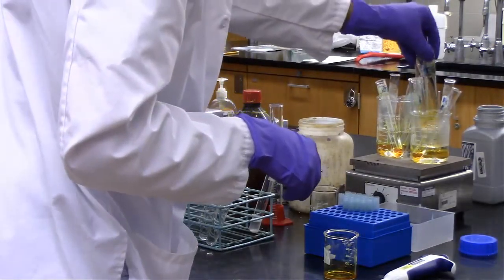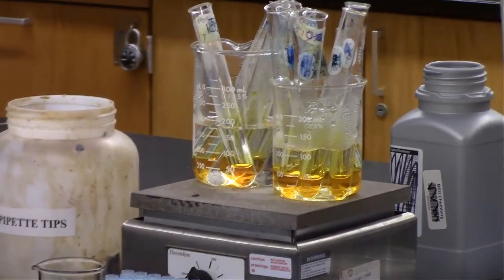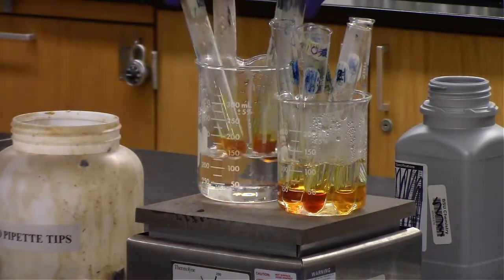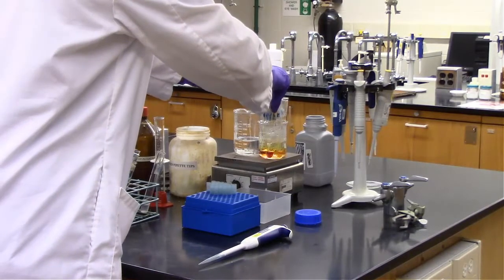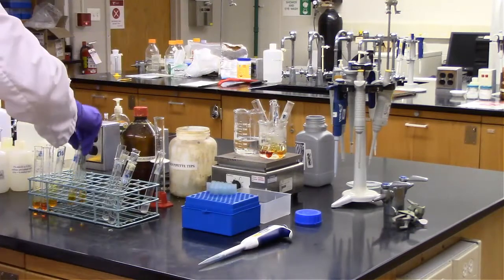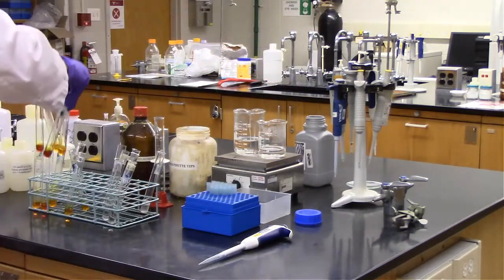Thinking of the pH again, the pH in your mouth is actually close to about 6.9. The pH in your stomach is a lot lower, so that's definitely acidic. But for alpha-amylase to function, it needs to be at a much more mild pH, about 6.9. So we expect to see a similar range of conditions for this experiment, where if we're at a very low or a very high pH, I don't expect the alpha-amylase to function at optimal capacity, but for the mid-range, I definitely expect to see the alpha-amylase be reactive.